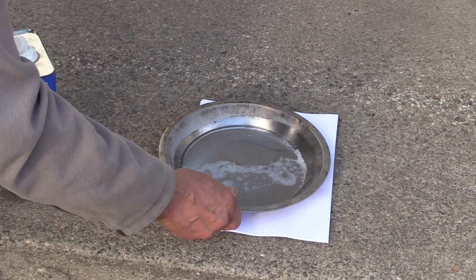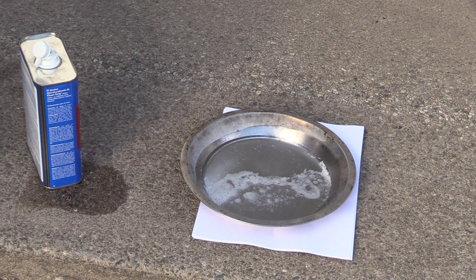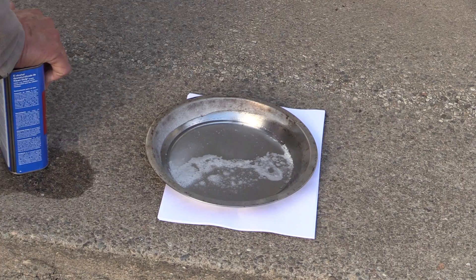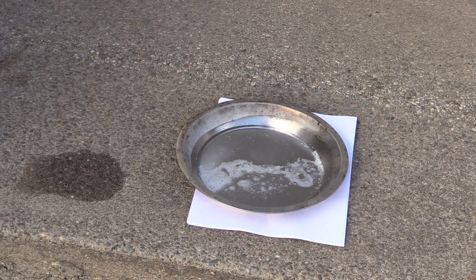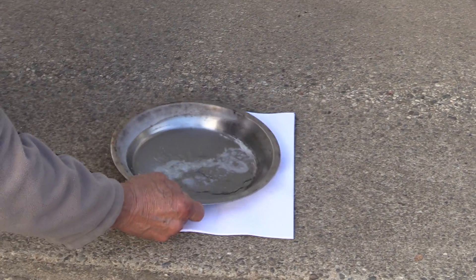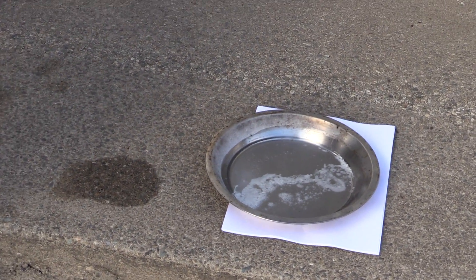I'm trying to get the liquor back. Denatured alcohol — is that ethyl and methyl mixed? Yeah, ethyl and methyl. Get that out of the way. It might or might not be as good. It's not dissolving quite the way I hope. Let's give it a try here. Let's go.